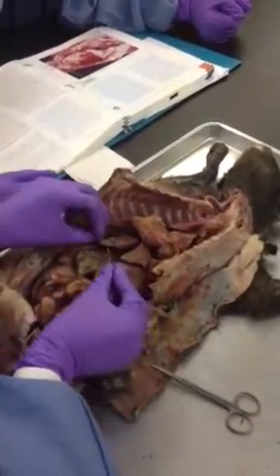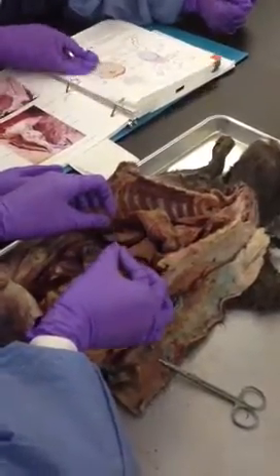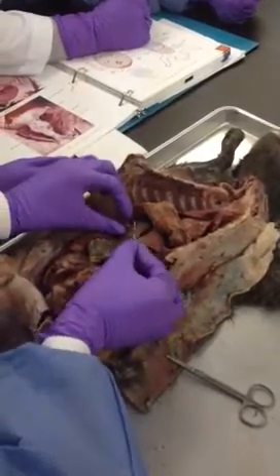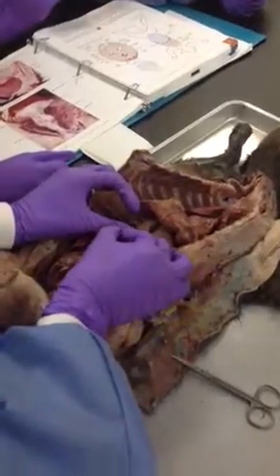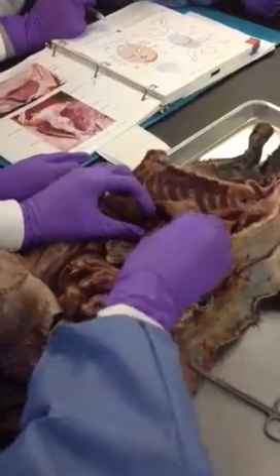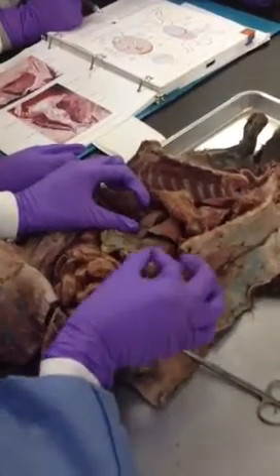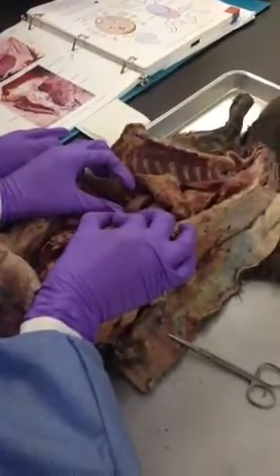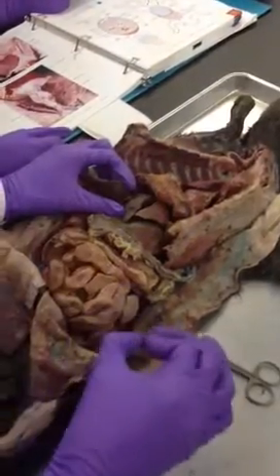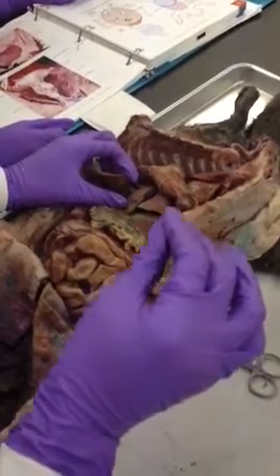They call this quadrate because it looks like 4 squares. Quadrate lobe. In between the quadrate lobe and the right anterior lobe is where you find the gallbladder. The gallbladder sits in an area called the cystic fossa.